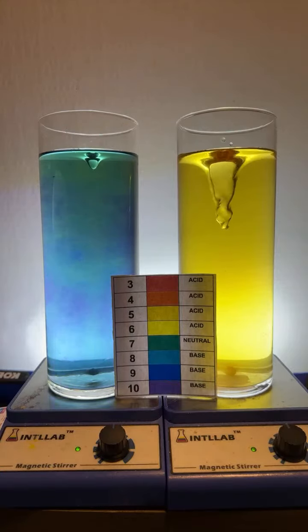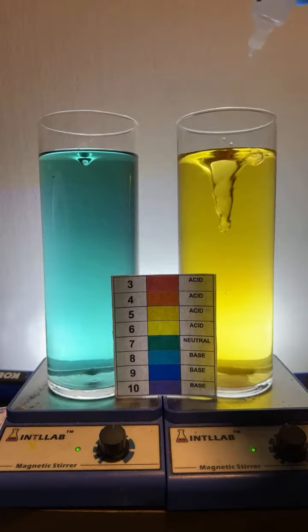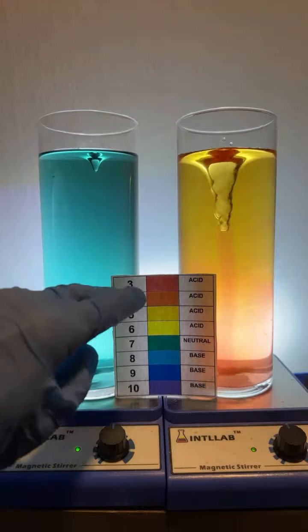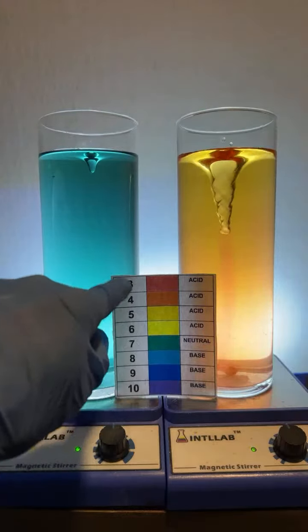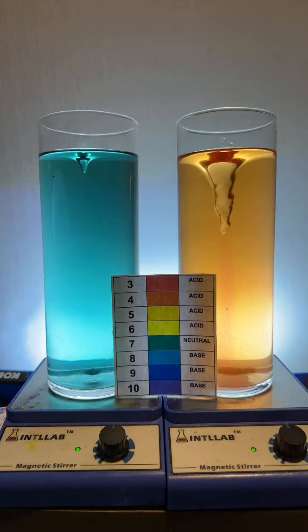Snowball, what I'm doing is experiments with acid, base, and acid-base indicator. As I add acid or base, the solutions change color, and you can tell what the pH is, and the acidity or basicity, by just keeping track of this color scheme here.